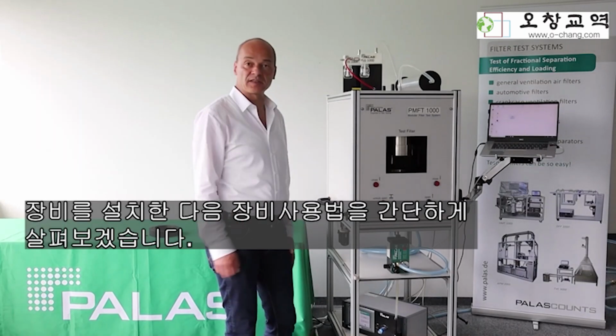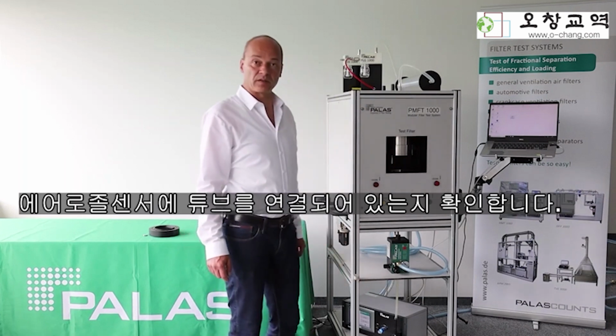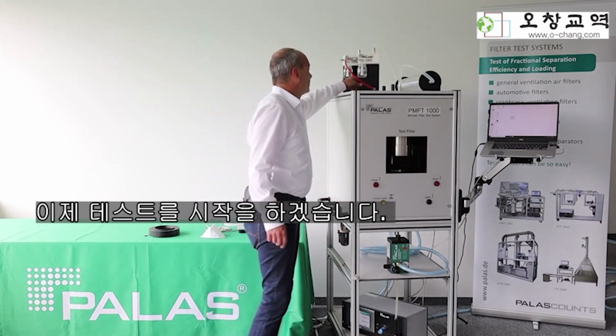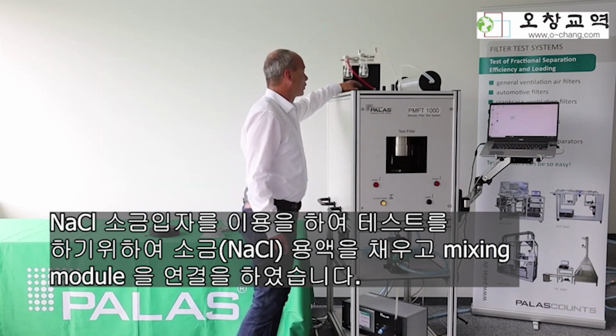Okay, we have finished installation and preparation of the instrument. I reconnected the tubing to the aerosol sensor. Now we can start with the test itself. We filled the aerosol generator already with the 2% sodium chloride solution.